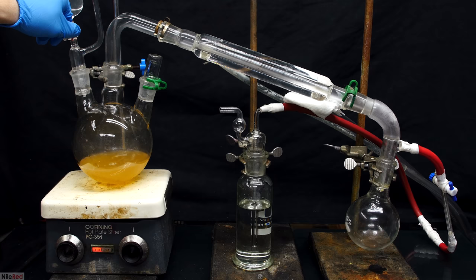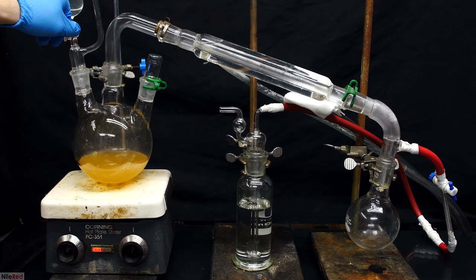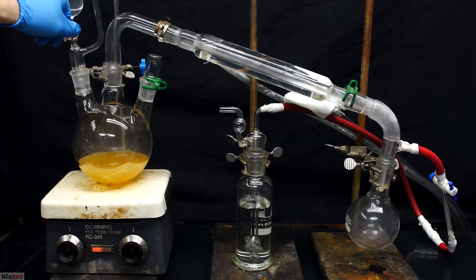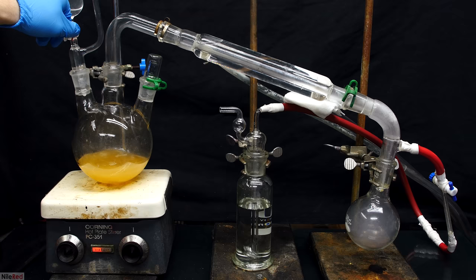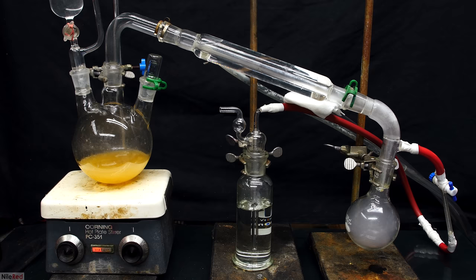If the trimethylamine gas was pumped directly through the hydrochloric acid without passing through a condenser and the intermediate receiving flask, it wouldn't be very pure. It's also recommended to include a drying agent in the receiving flask, something like sodium hydroxide, but I opted not to do this. Also, I've added a stopcock valve to the hosing, and later on you'll see why it's important.